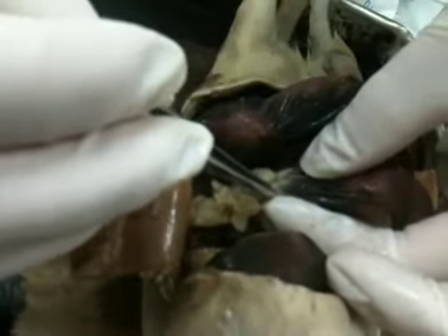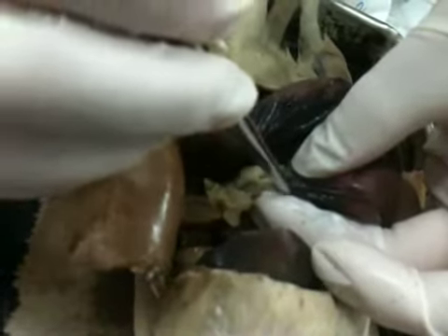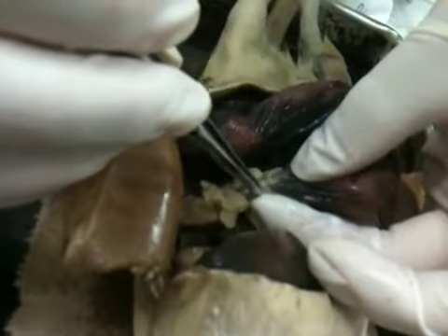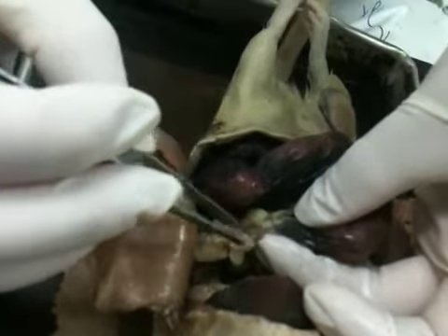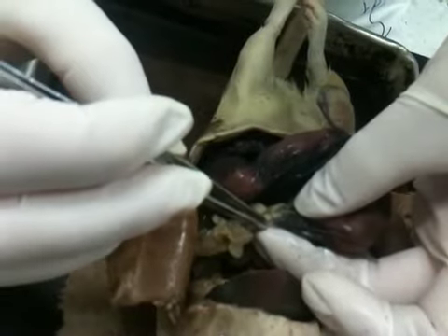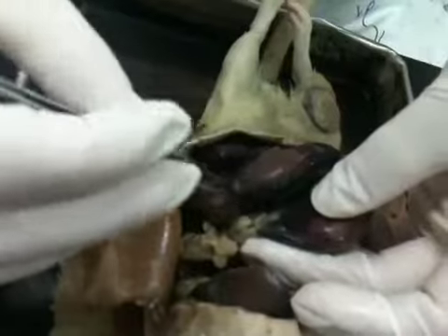And this narrow neck right there, that narrow piece that connects the ovary and the uterine horn, is the fallopian tube, or what's known as the oviduct. So either one works, oviduct or fallopian tube. So ovaries, fallopian tube or oviduct, and then uterine horn that surrounds the baby.